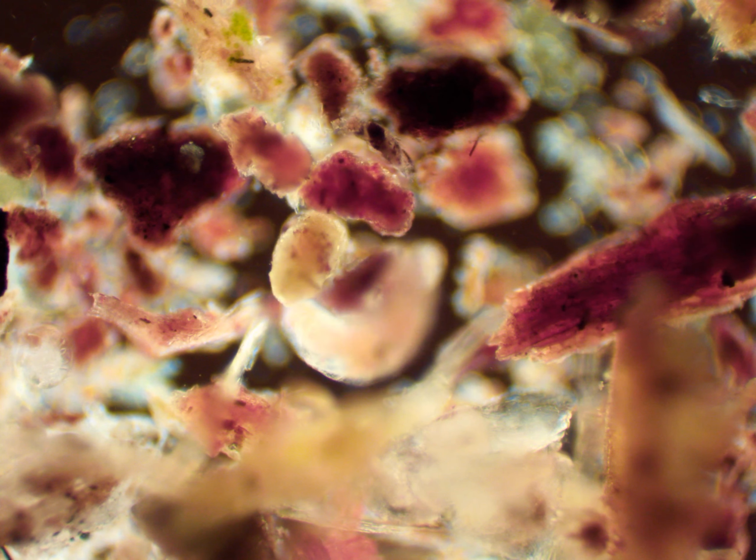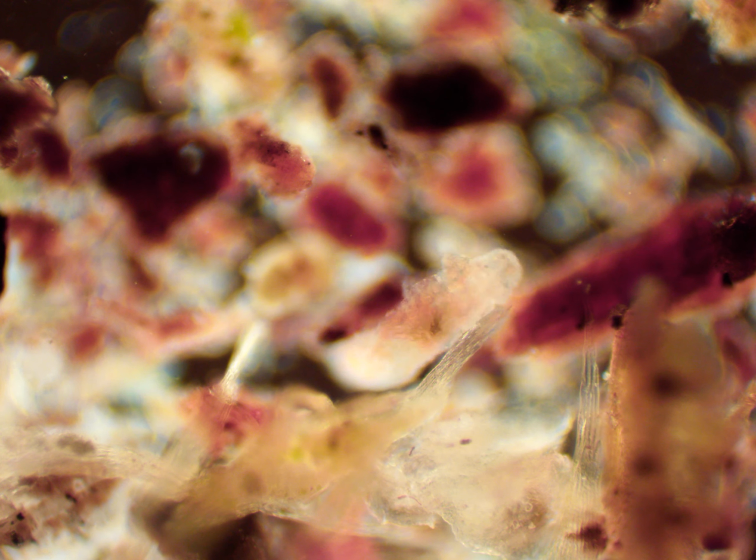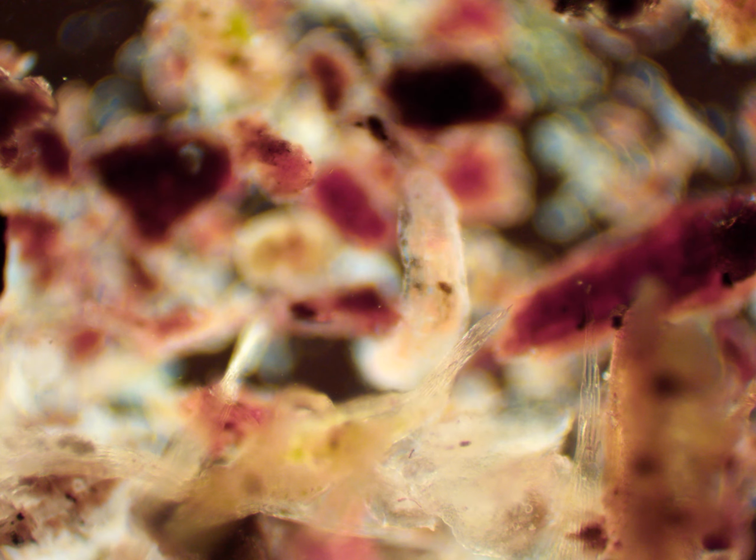So this is a video my mom wanted me to make. It is about tardigrades. She wanted me to find one and I eventually found one for her, so this video is for her. You can see this tardigrade in darkfield walking.